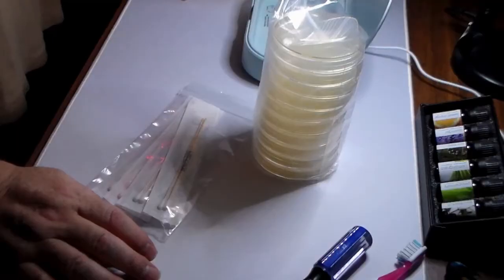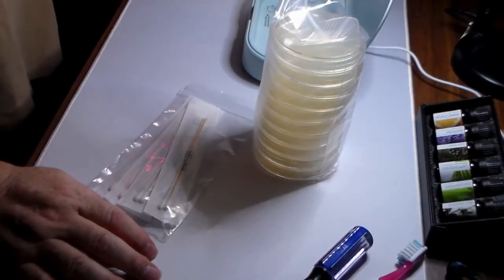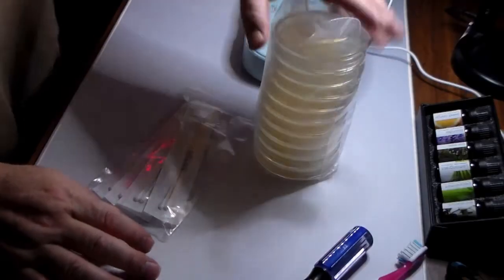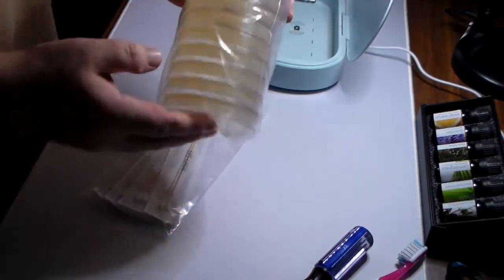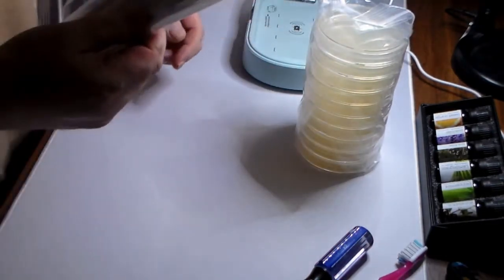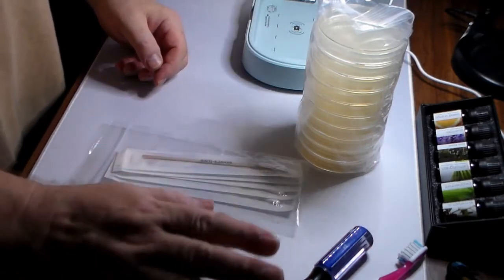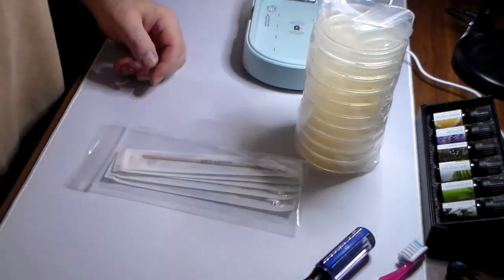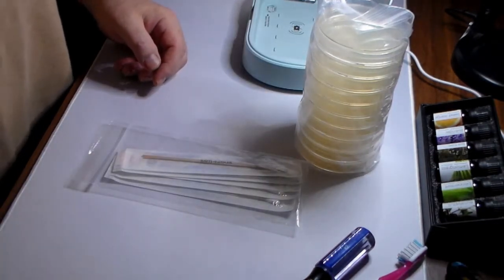All right, here we are. The Ratchet lab is in action. I have all the parts and pieces I need. I have calibrated my incubator. I have the petri dishes with the agar. I have sterile swabs. I have my test items. I have gloves. And I have boiled water. And I think I'm ready to start.